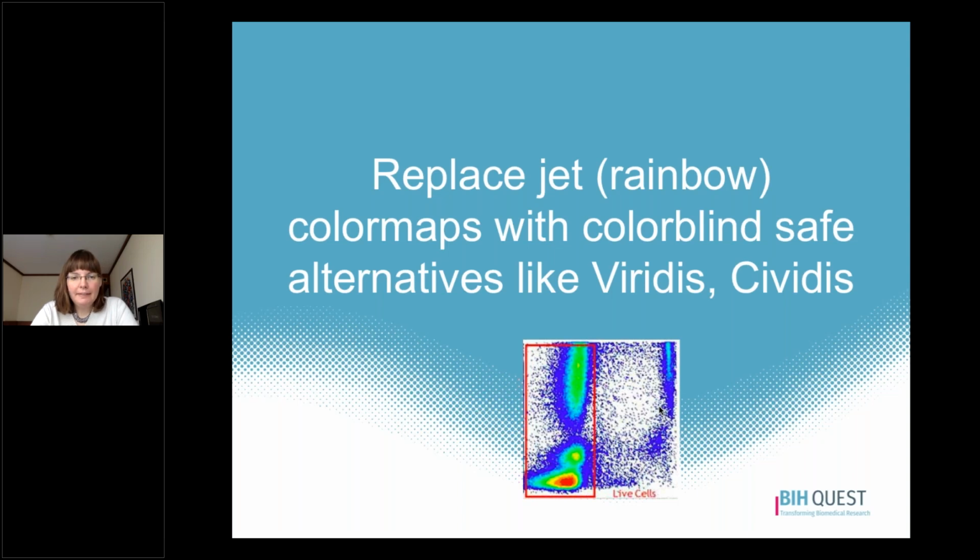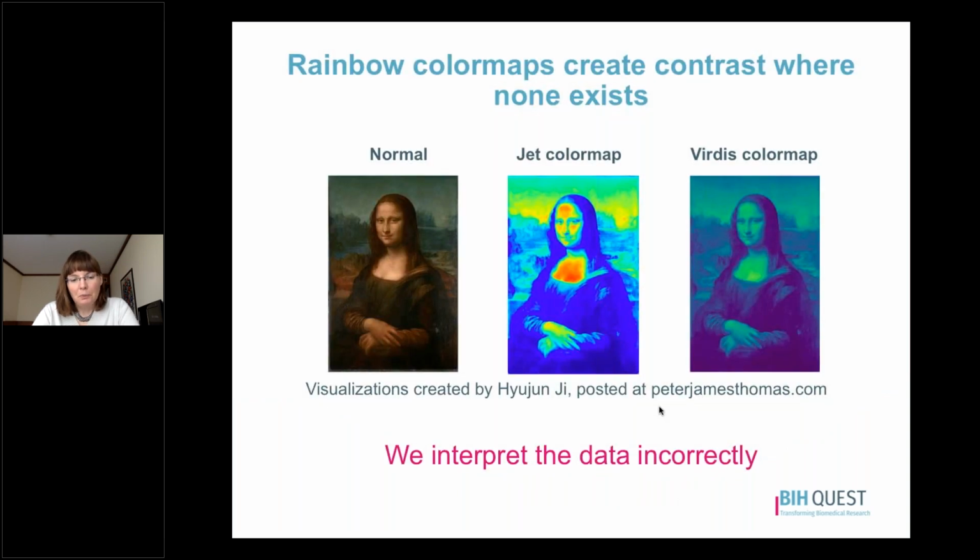Okay, the next thing that's important to do is to identify when you're using a jet or rainbow color map and replace them with colorblind safe and perceptually uniform alternatives such as the Viridis or Cividis color maps. Rainbow color maps are really common in science as well as in popular media. However, they're highly problematic from a visualization perspective, so it's important that we get them out of our science. Let's talk about why.